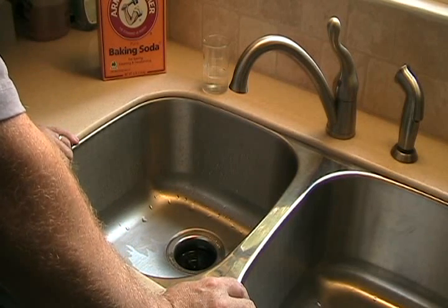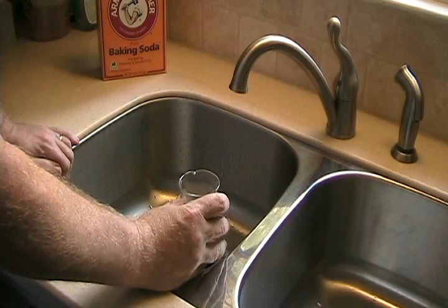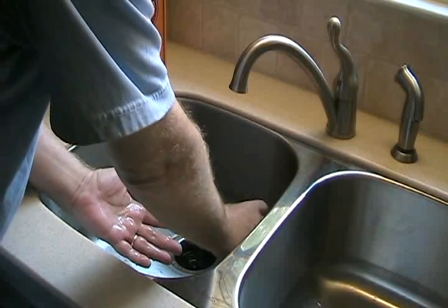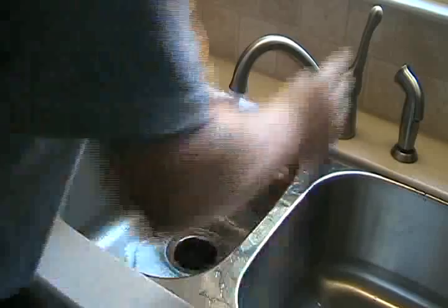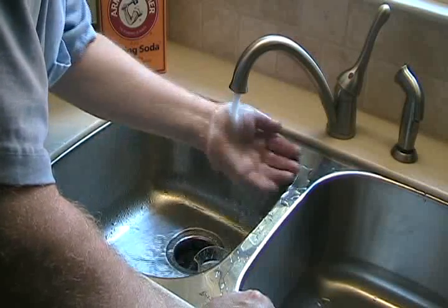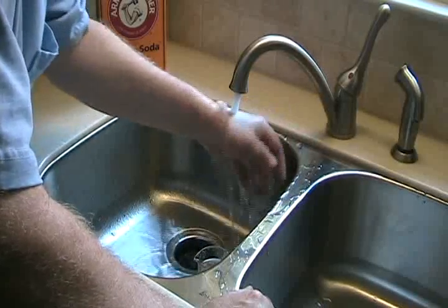In the next segment we're going to take a quick look at one common occurrence in a lab and a second one that we hope never happens. So what happens if worse comes to horrible and you do spill something on yourself? Well, the water faucet is your best friend. I have here about 50–60 milliliters of concentrated hydrochloric acid and I'm going to demonstrate. I'm not wearing gloves. I am wearing goggles. And I can tell right away that it's not water — it's very astringent and now it's starting to sting. So by this time you've had time to get over and run cold water. It has stopped stinging entirely. But keep running cold water over any toxic or corrosive substance that you get on yourself.